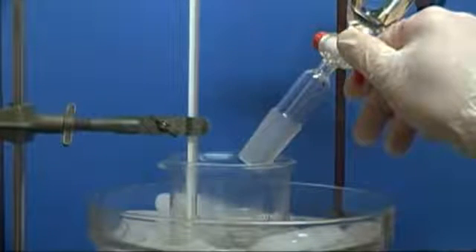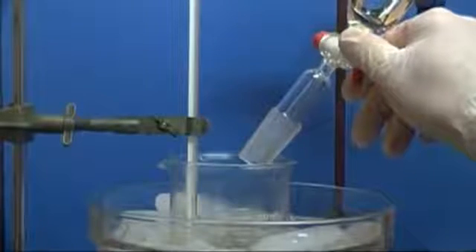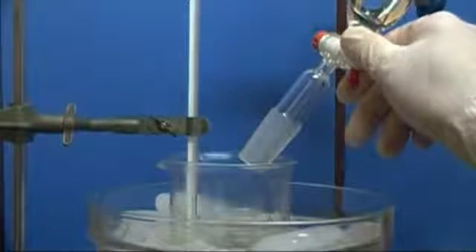Setting it up like this works well as you can do other things in the lab while keeping a very close eye on it. The complete addition of the benzene took about an hour.